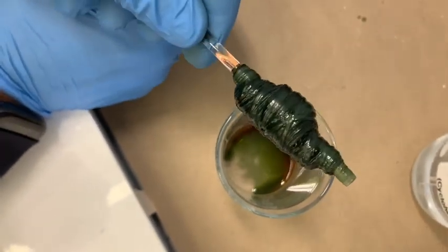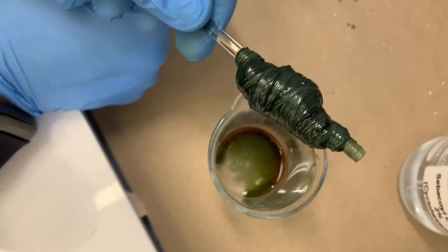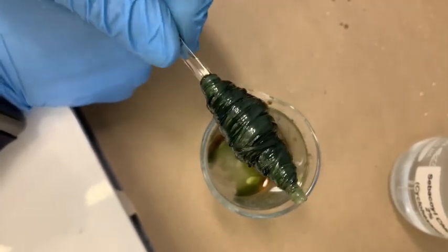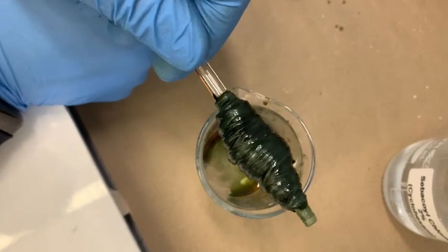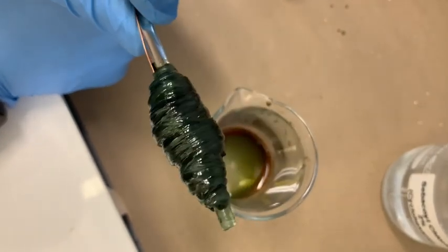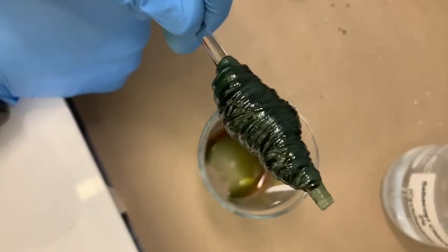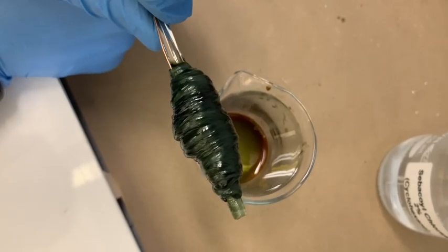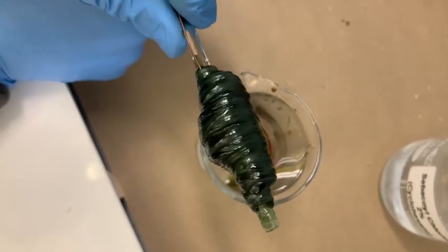So what you could do is you could wash this off and then you could dry it. And that would give you some pure, clean nylon. But I'm probably just going to let this hang out in a heap in the solid waste bin. But it is interesting. And then next time, maybe I'll produce a remotely desirable color. That would be great. We will see.